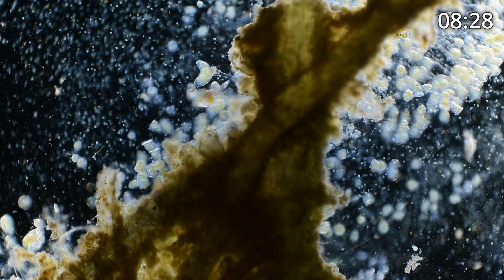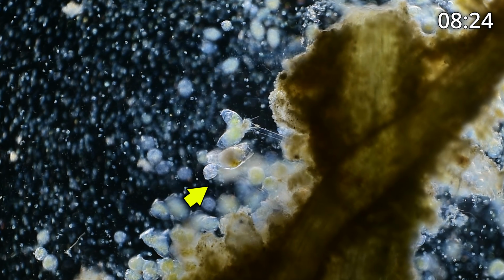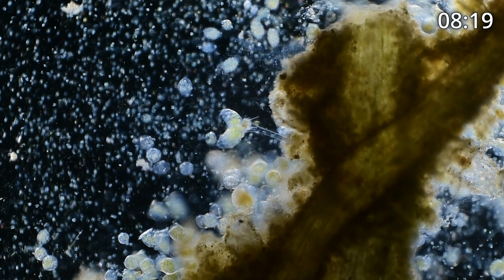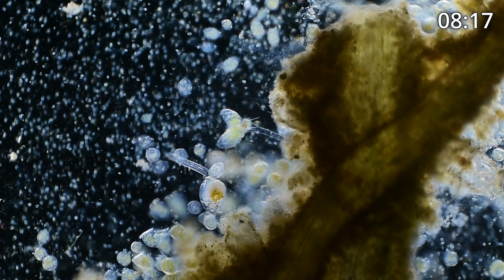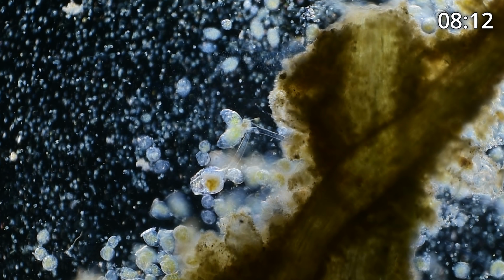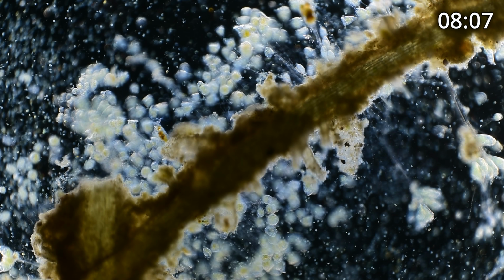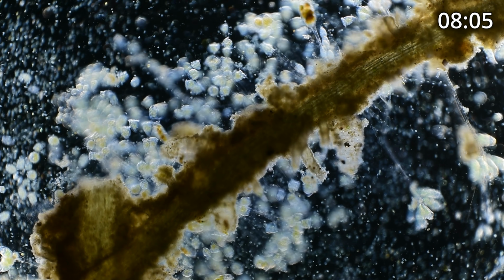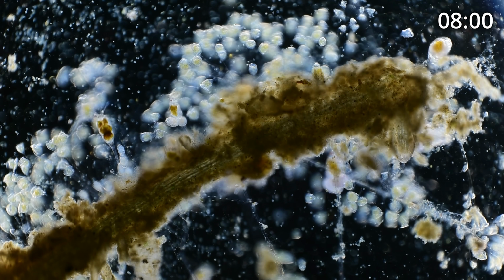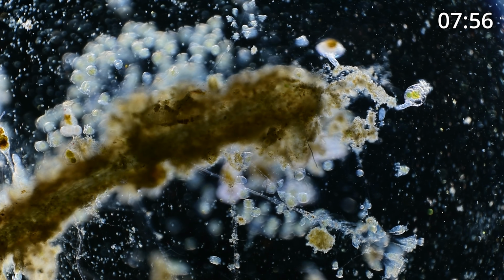Let's see if I can get a nice view right in the middle now. I'll put an arrow on there. I don't know what kind of rotifer this is, but you can see it's attached with its toe, its foot, and it really thrashes around, and toward the back end you can see an egg attached to it. It seems that there are a lot of those with eggs in this sample that I took, which means it's probably a very healthy, nutritious environment. I'm sure you'll be seeing more of them like that as we look around.